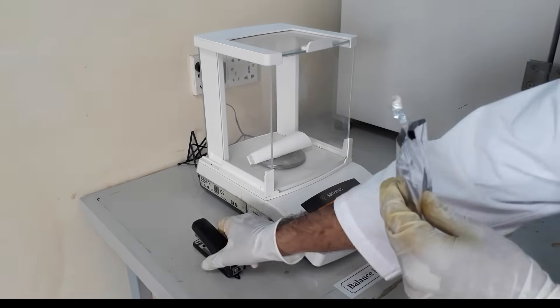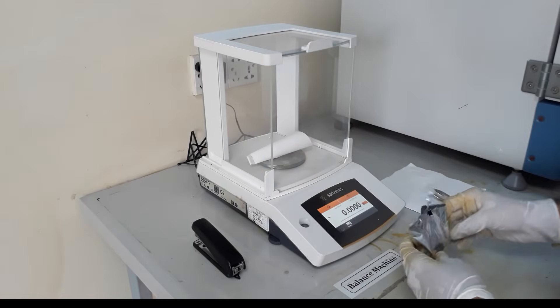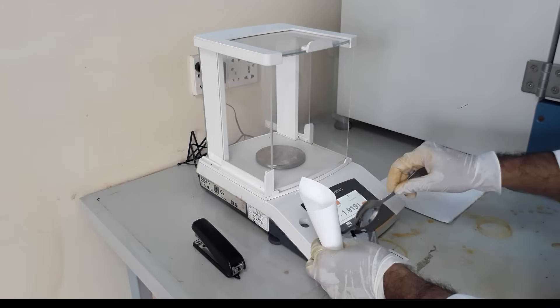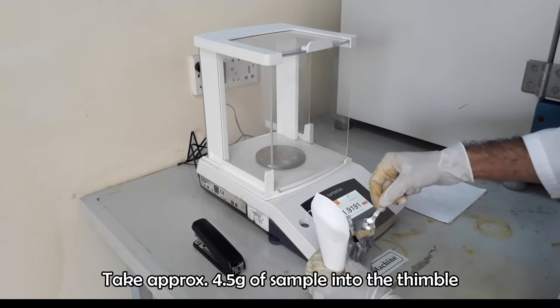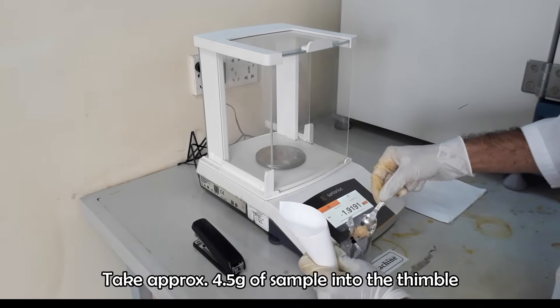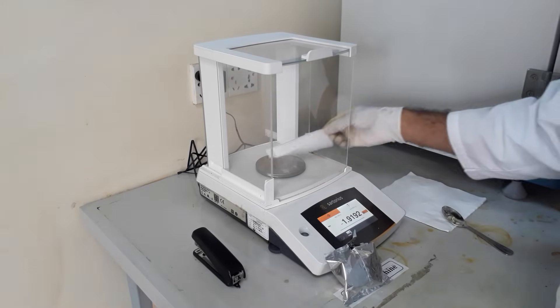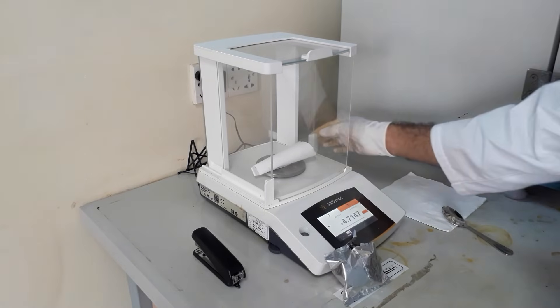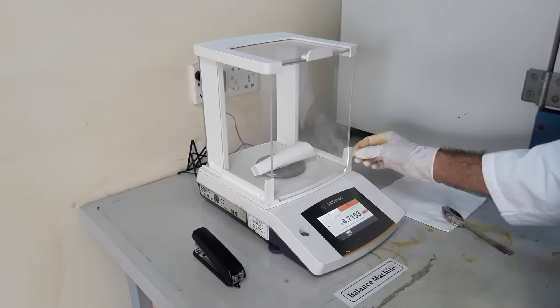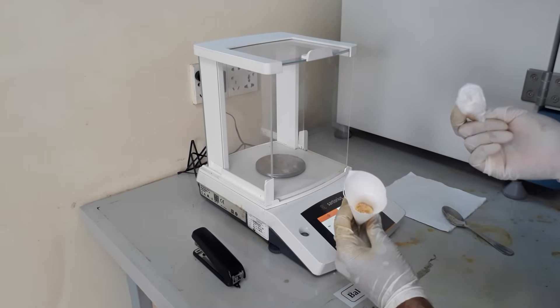Now we have to prepare the sample. Solid sample should be ground and crushed before testing. Take one to five grams of homogenized sample into the previously prepared thimble. Sample weight varies depending on the expected fat percent. Note the sample weight.